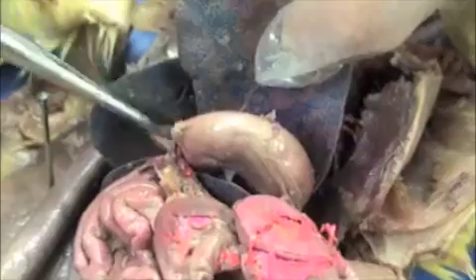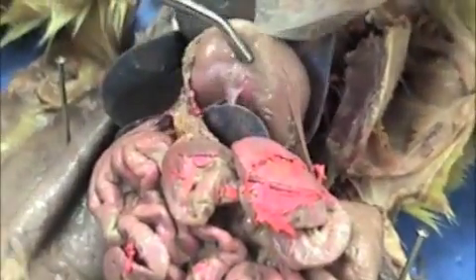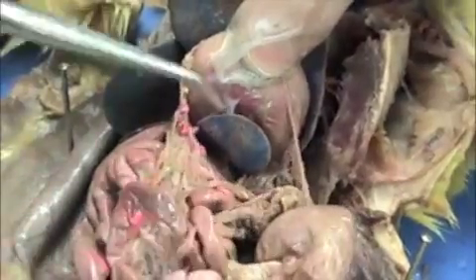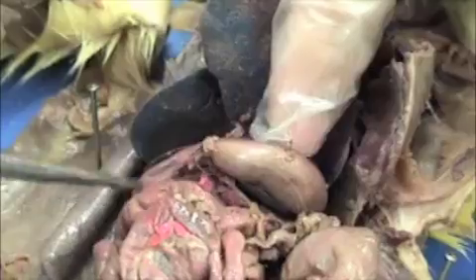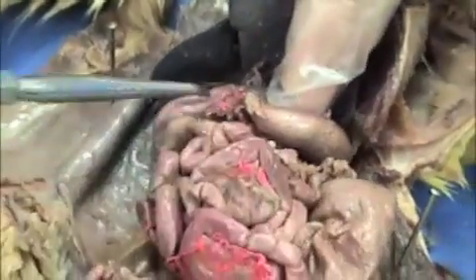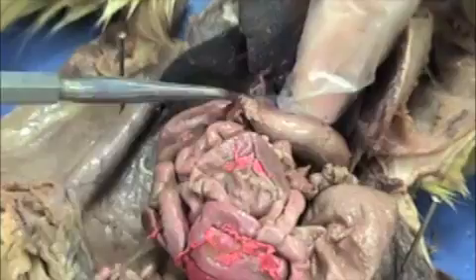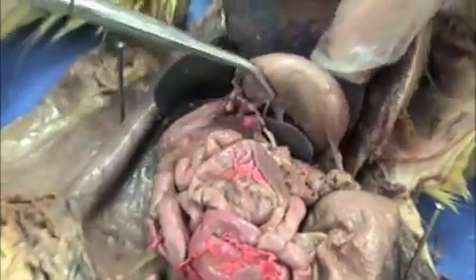This is the liver. If you move the liver up, you have the stomach. The stomach leads to the small intestines here. You can see it better on the other rat, but that's the small intestines.